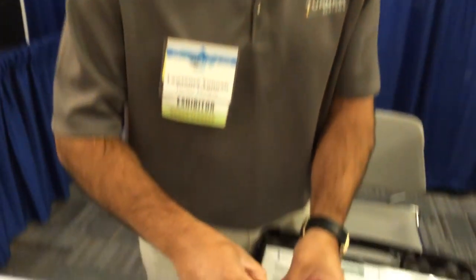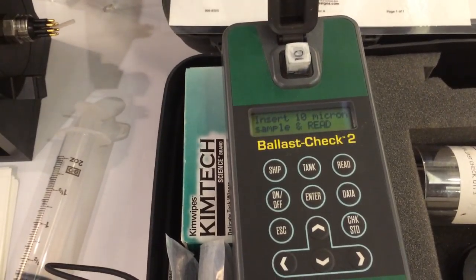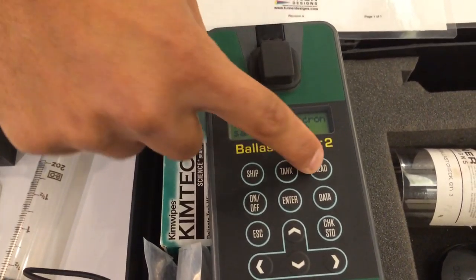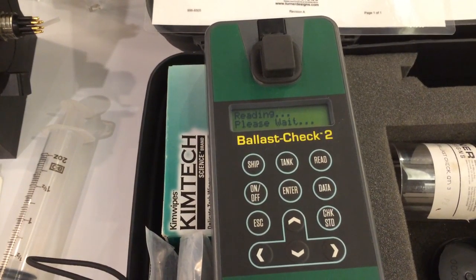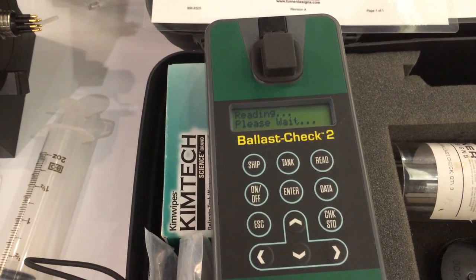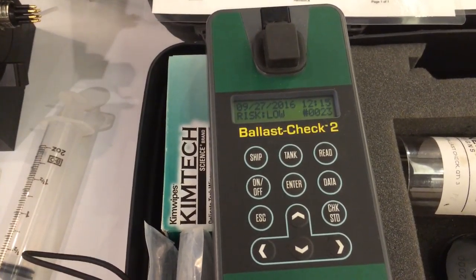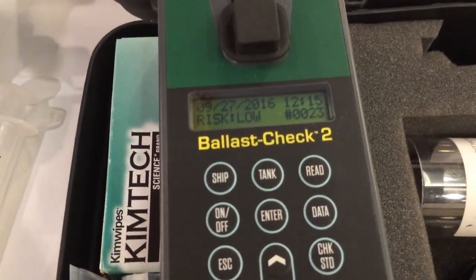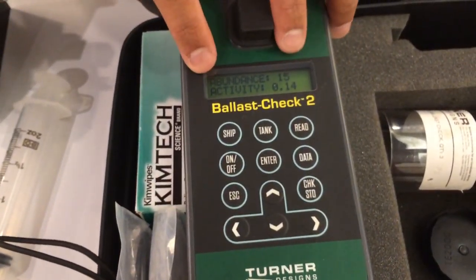Now I have a 10-micron filter that I'm going to put in here. I do that because I don't want to see anything less than 10 microns interfering with my signal. Then I press read and it's going to tell me that I have a low risk of contaminating my surrounding water — and now I can tell how much algae is in there.